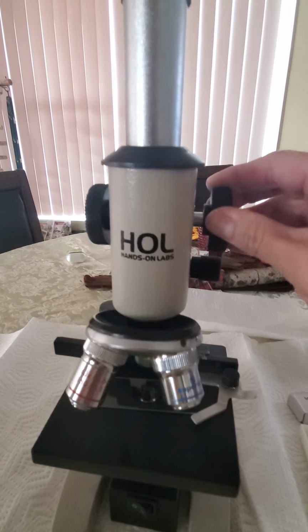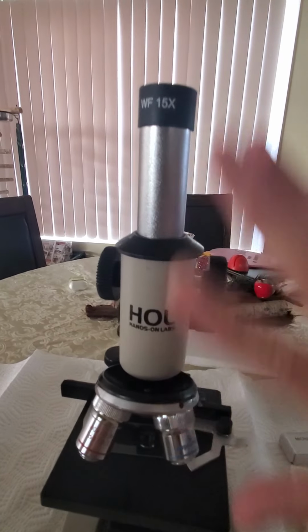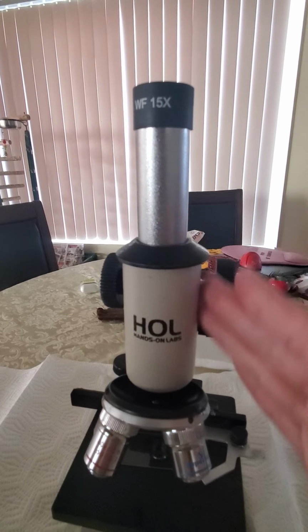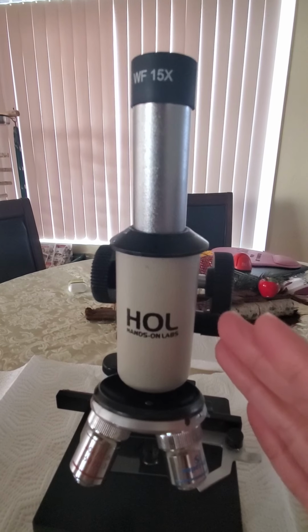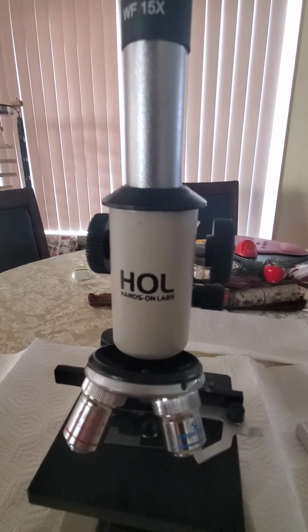The idea of the depth is amount too close, amount too far. So that's the depth of the image. So there are two different things: the space of your object and the depth, how close or how far I am from the image that I am examining. Image space, object space. That's basically the difference.